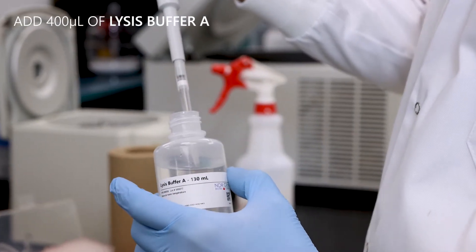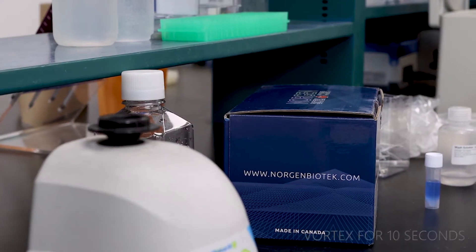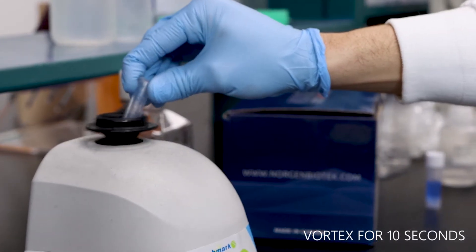Next, add 400 microliters of Lysis Buffer A. Vortex the lysate for 10 seconds.